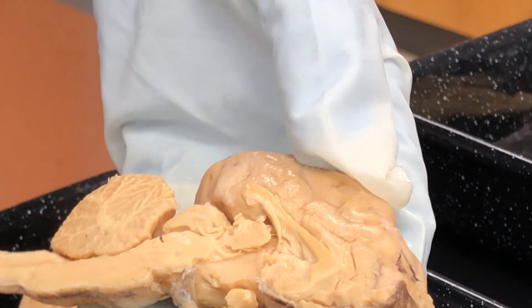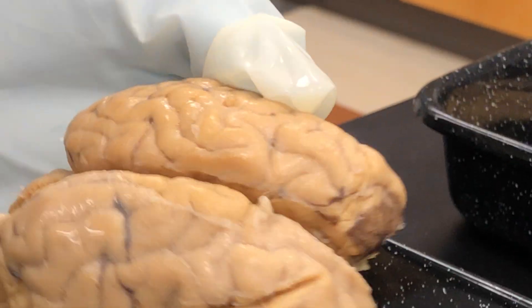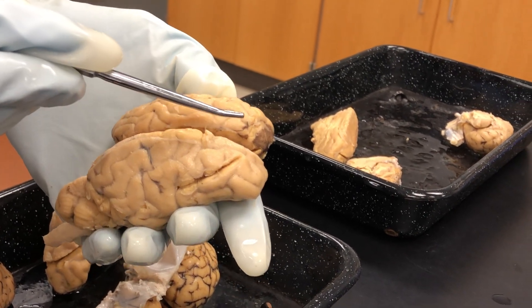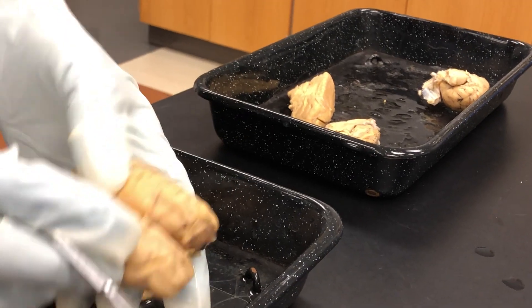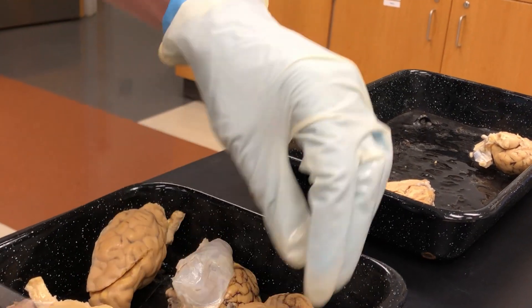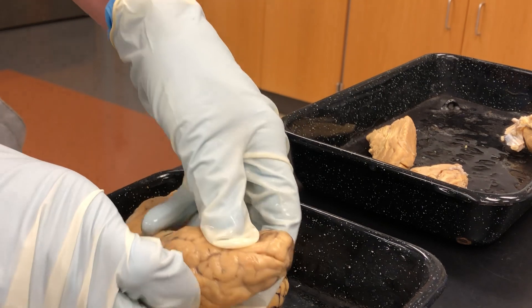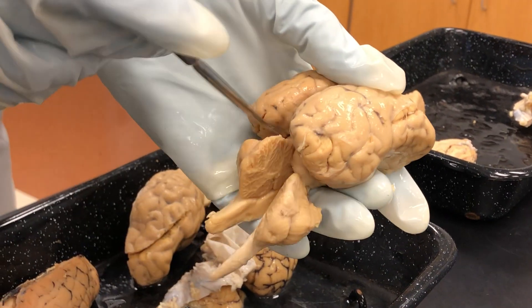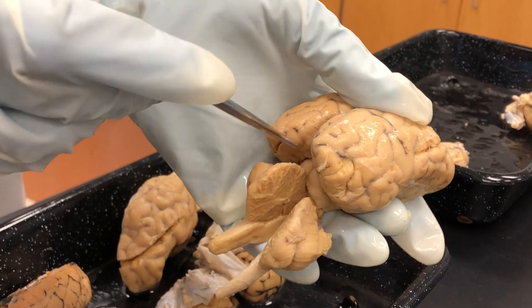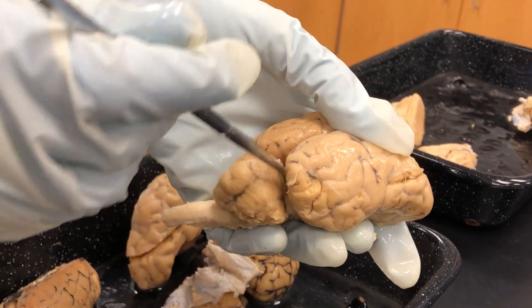The last structure in the dorsal view is the transverse cerebral fissure. The transverse cerebral fissure can only be seen when you have two hemispheres together. It is the fissure that delineates the cerebrum from the cerebellum — running transversely across the posterior aspect. So if you look at it like this, it is this fissure right here.